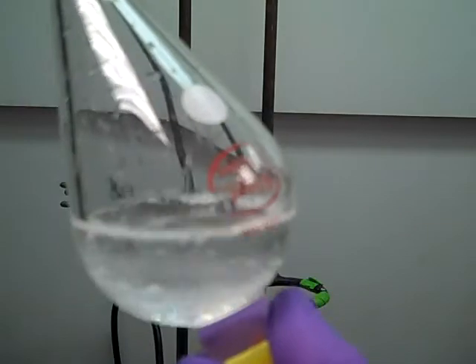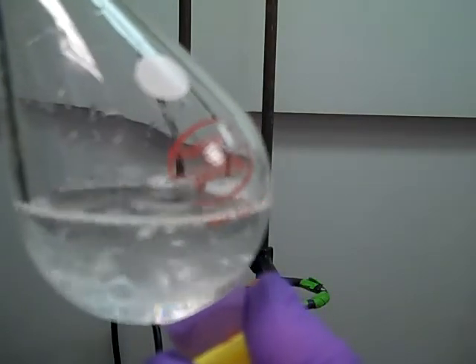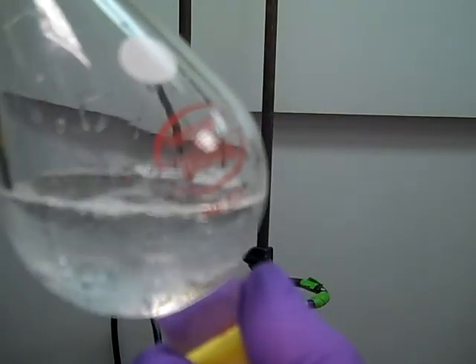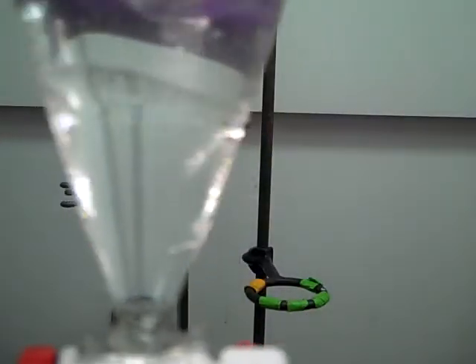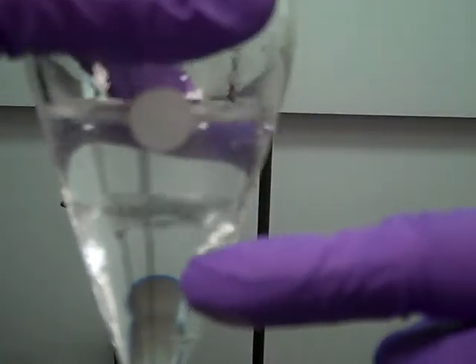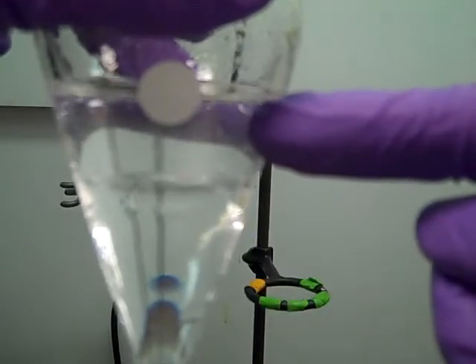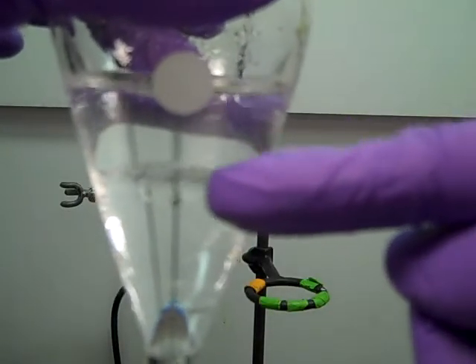So at that point, everything inside your mixture should have gotten ample chance to mix with each other. And then if we turn that back over, we can still see we've got two distinct layers, a bottom layer and a top layer. Notice the interface right here.